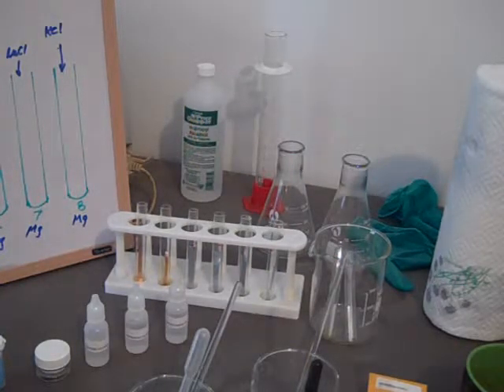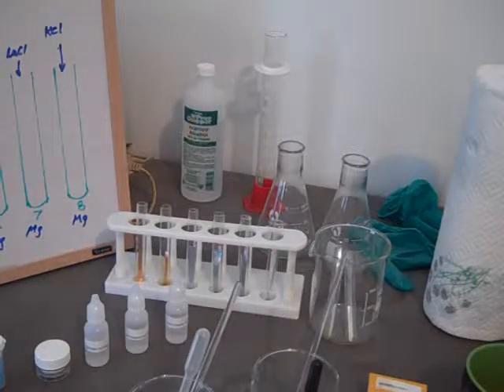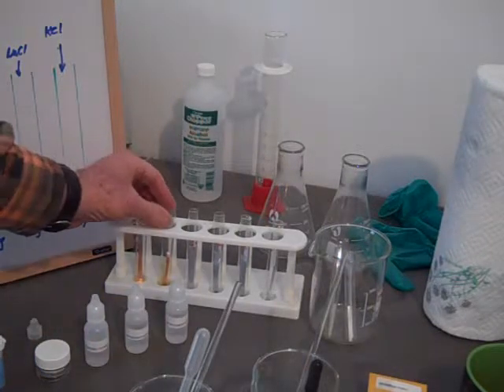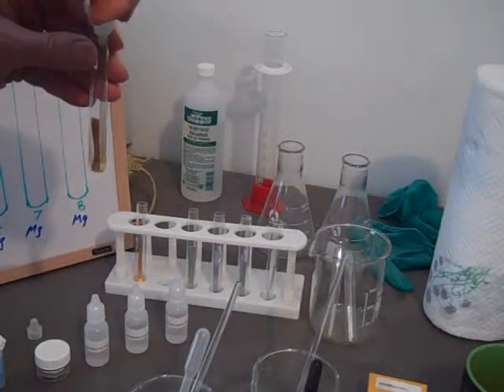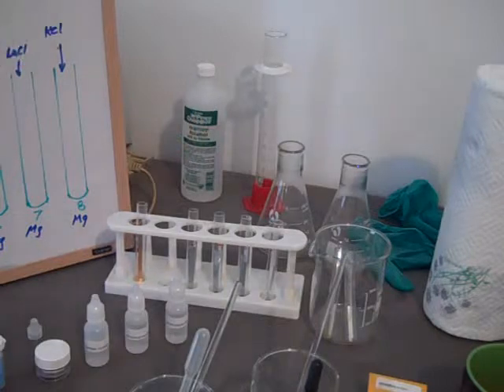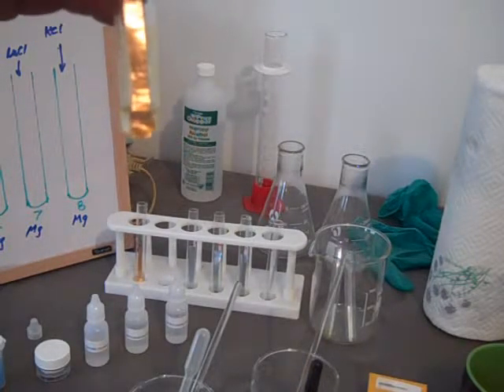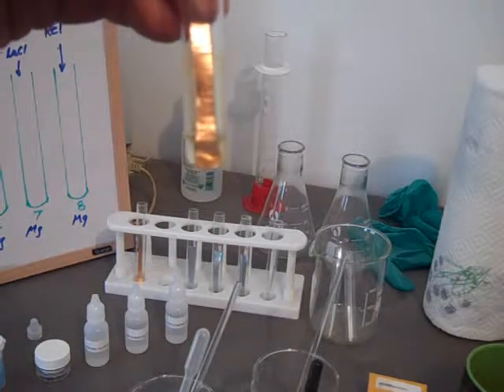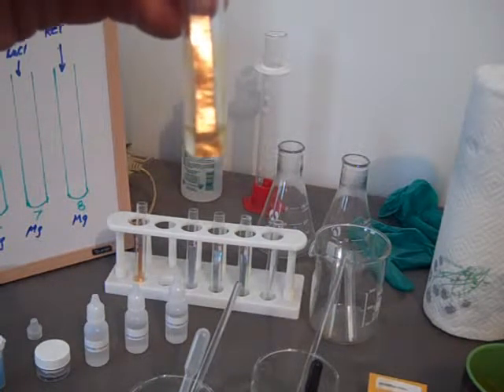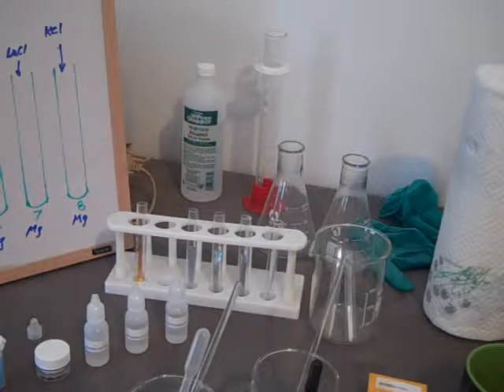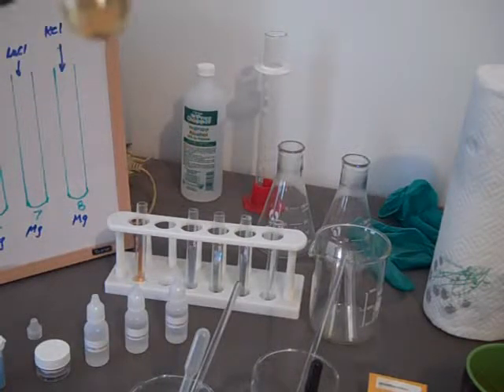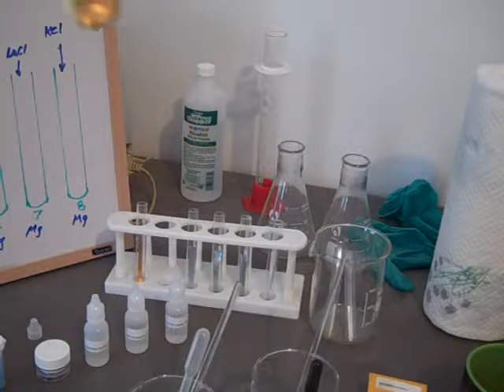Next, we're going to check the effect of silver nitrate. Now, you know, silver nitrate is lower on the activity series than copper. So copper should replace silver nitrate. Let's try it and see what happens. We should get some sort of reaction here. We'll look at it, and I'll inspect it with you. And yes, indeed, you might be able to see that the bottom of the strip of copper is darkening. Something's plating on it. It appears, if you can see it, I'll pull it out maybe later. But there's a gray, sort of, a gray-white substance plating on the copper. That'll be your silver.